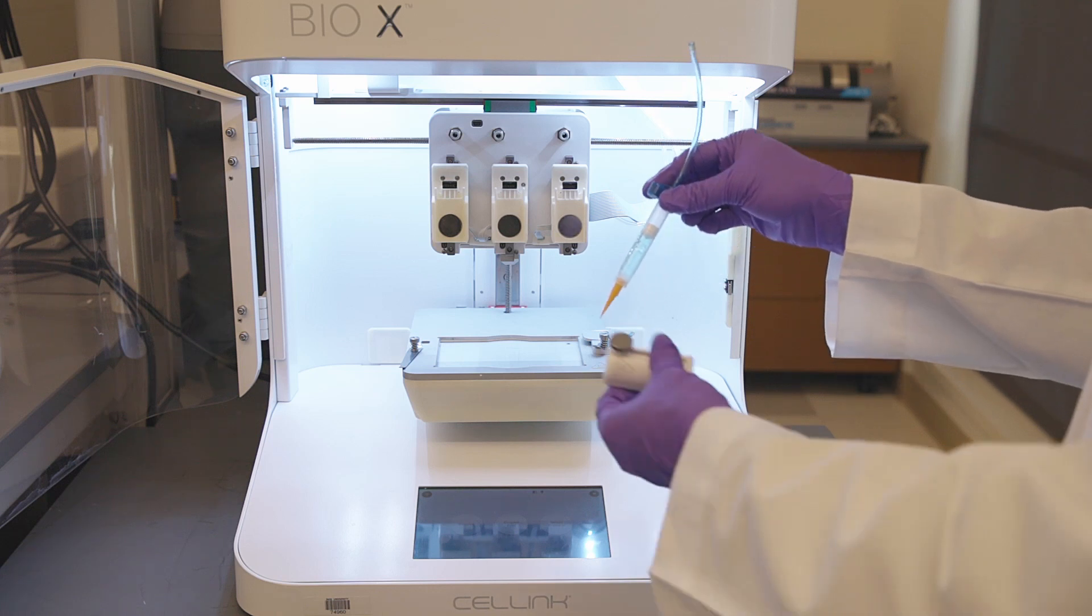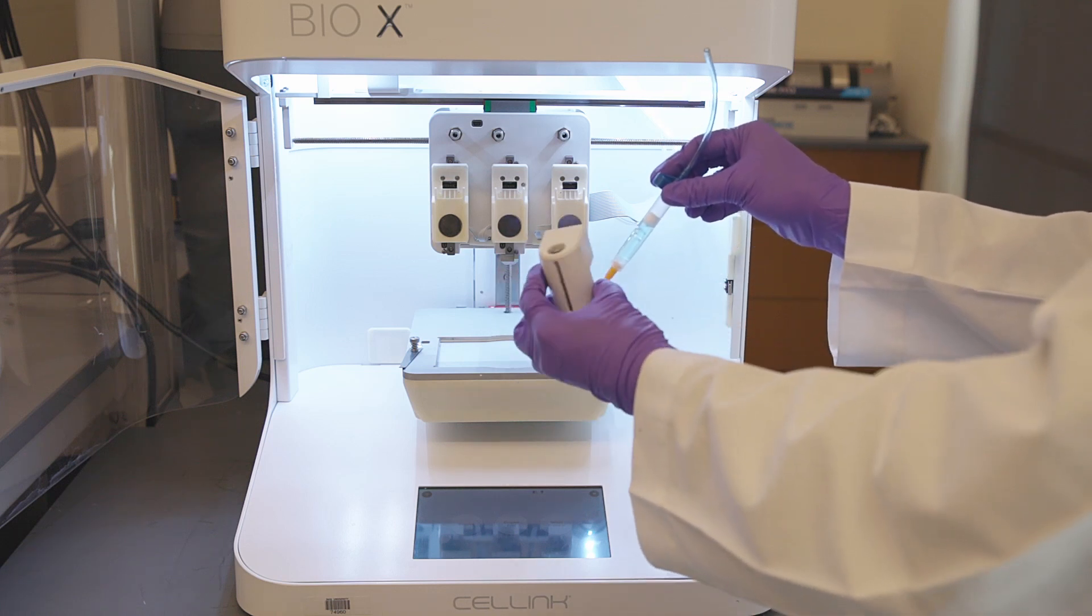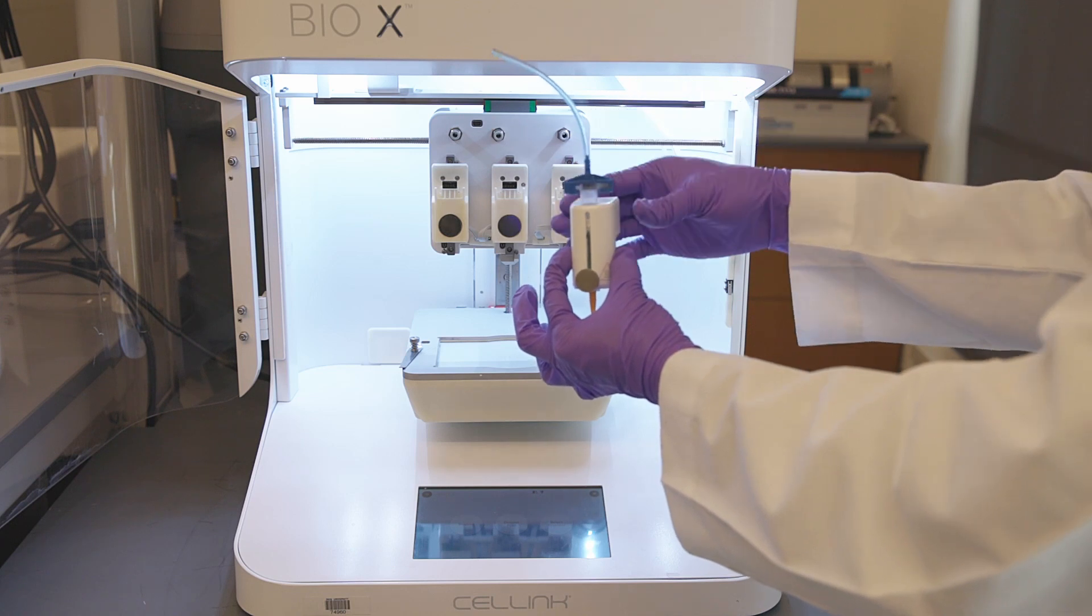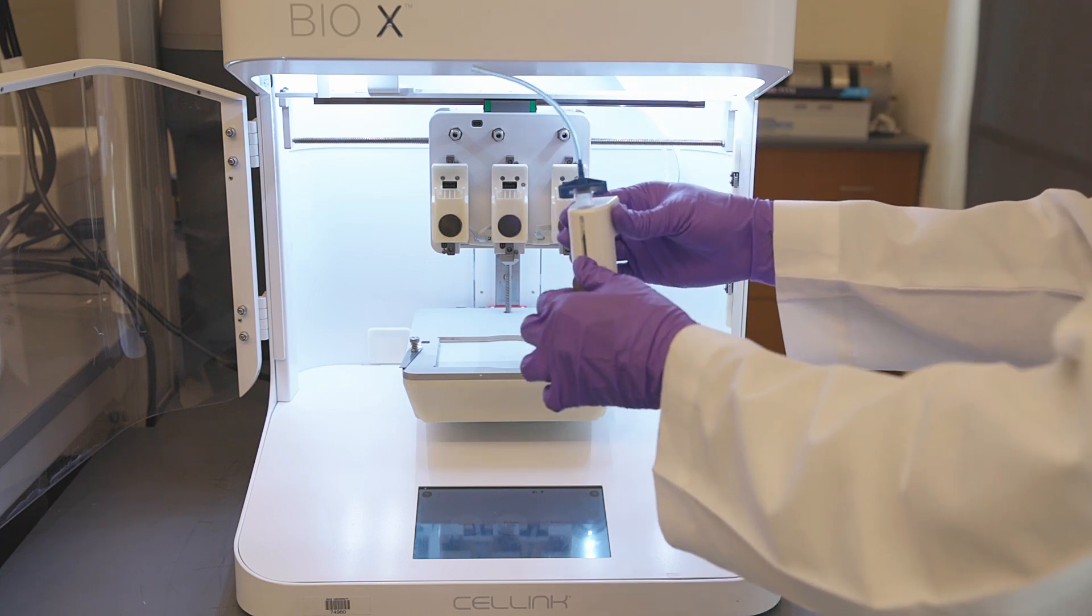Transfer this assembly into the printhead. Tighten the screw to secure the syringe in position.